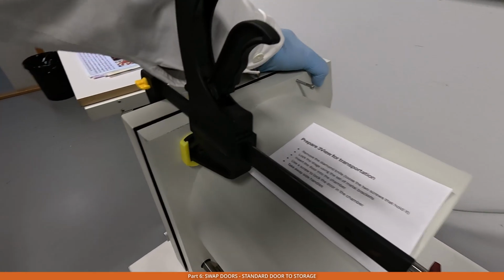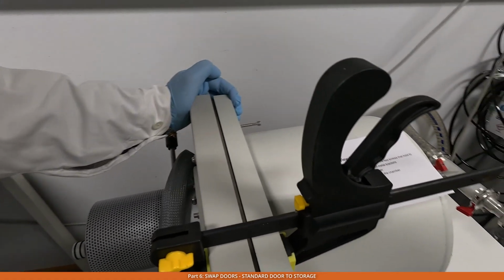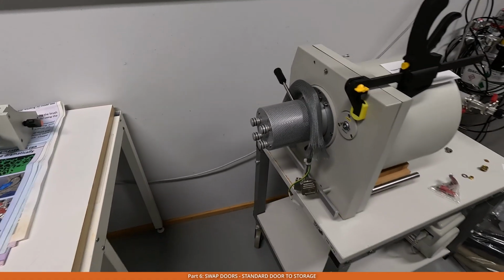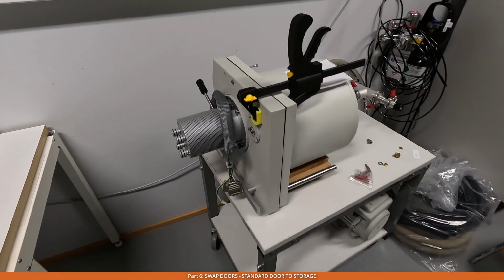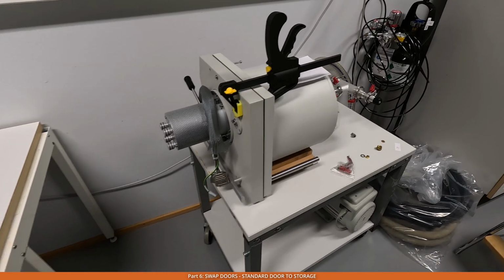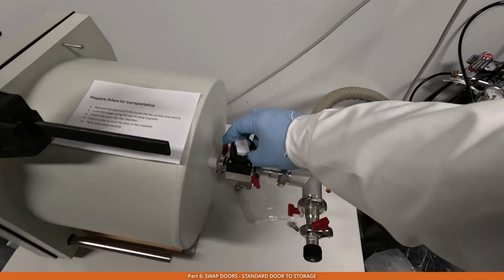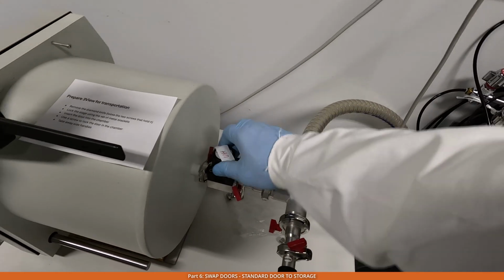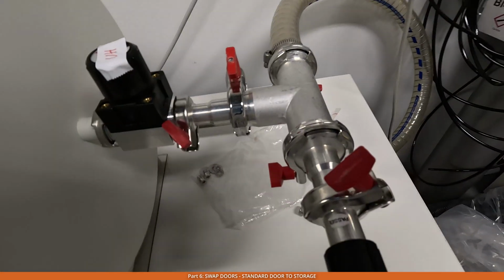And then I would press it a little bit from the side to make sure that the vacuum is actually forming inside the chamber. We can keep it for a few minutes to make sure that the air is pumped away from the chamber. To finish pumping, I will close this valve and open this valve and then stop the pump.